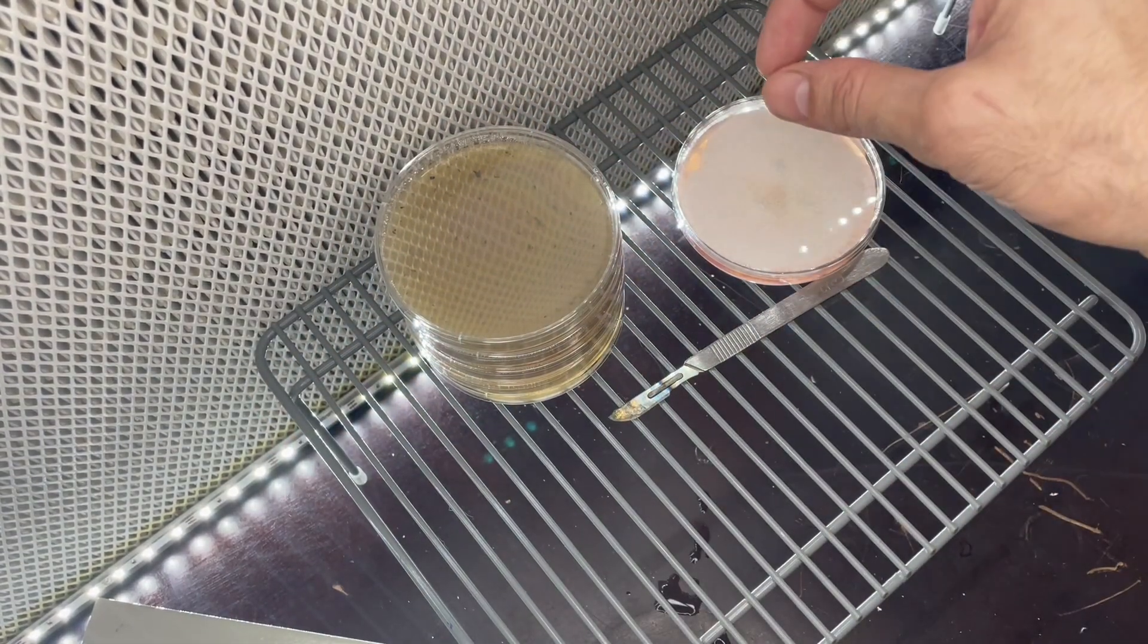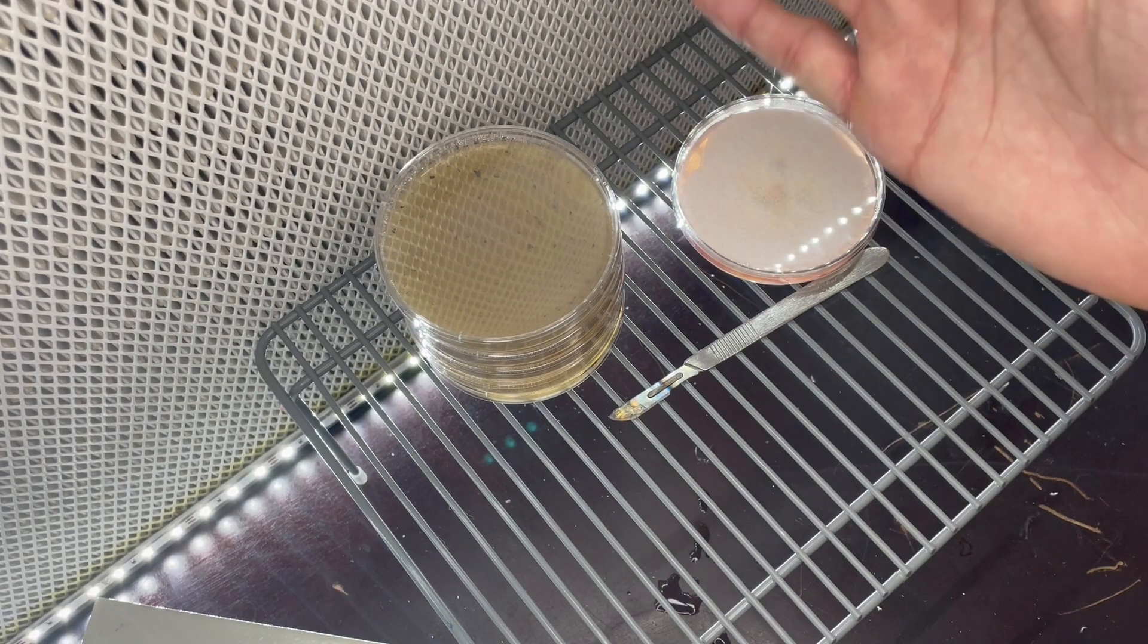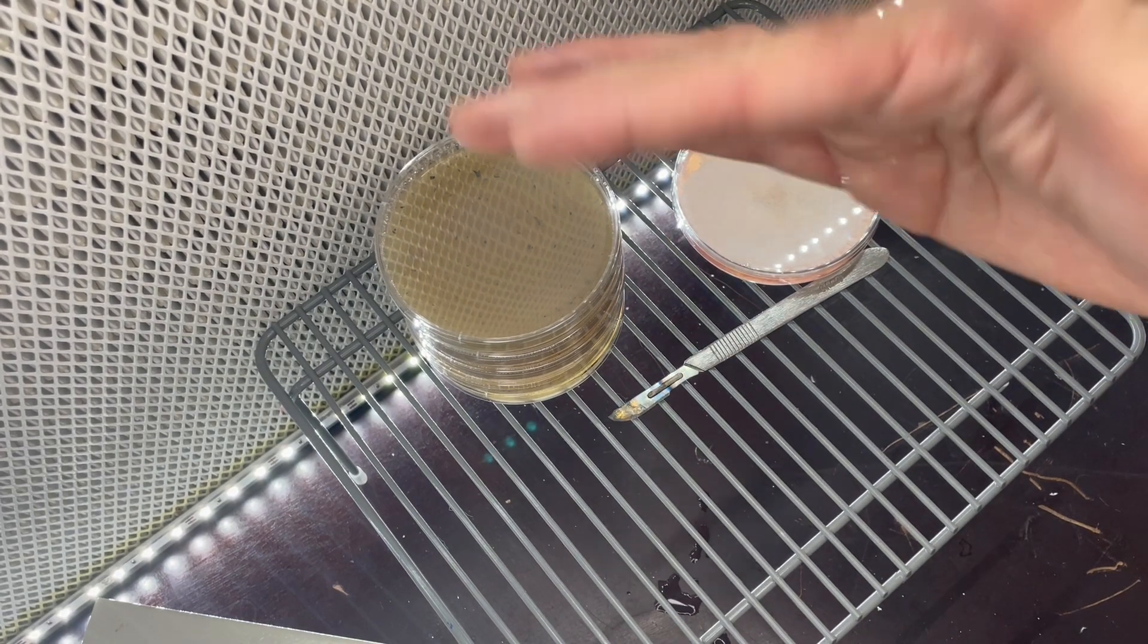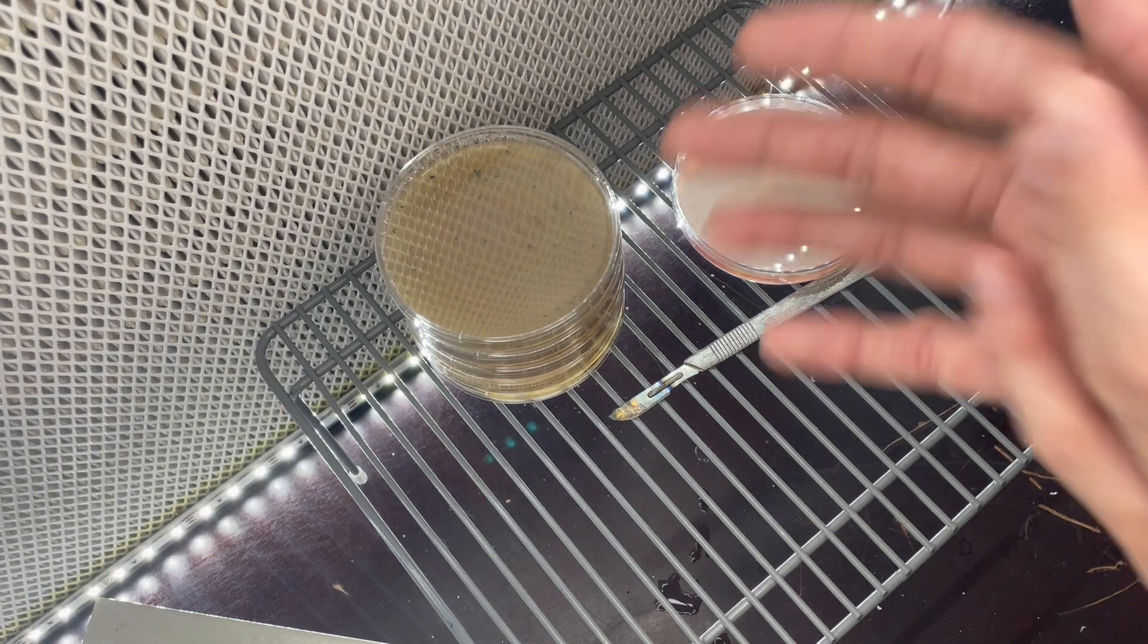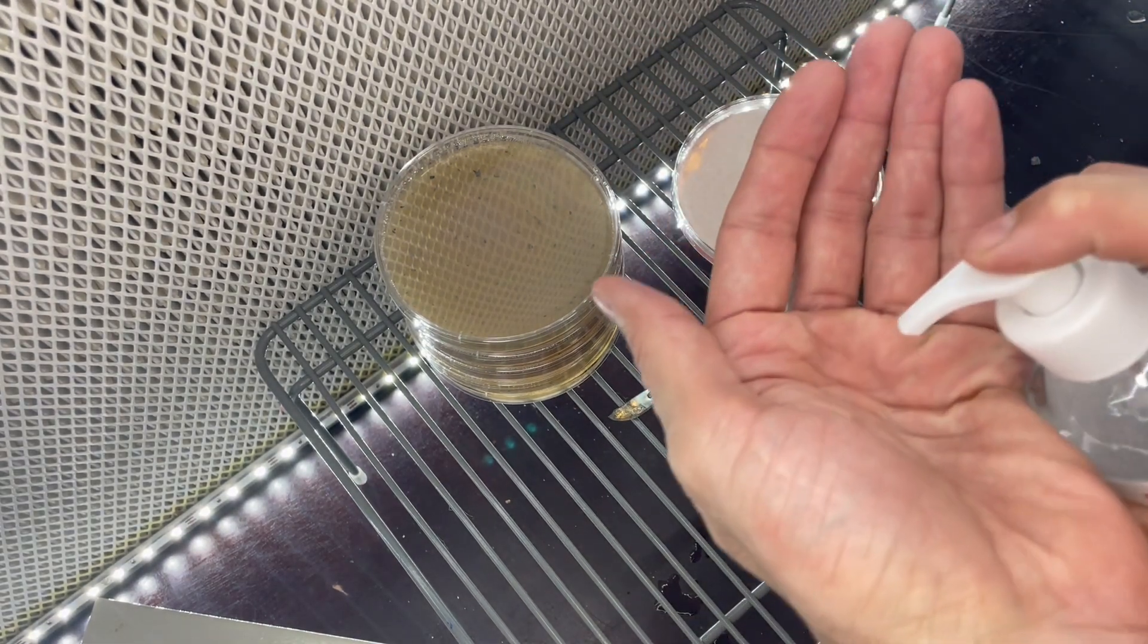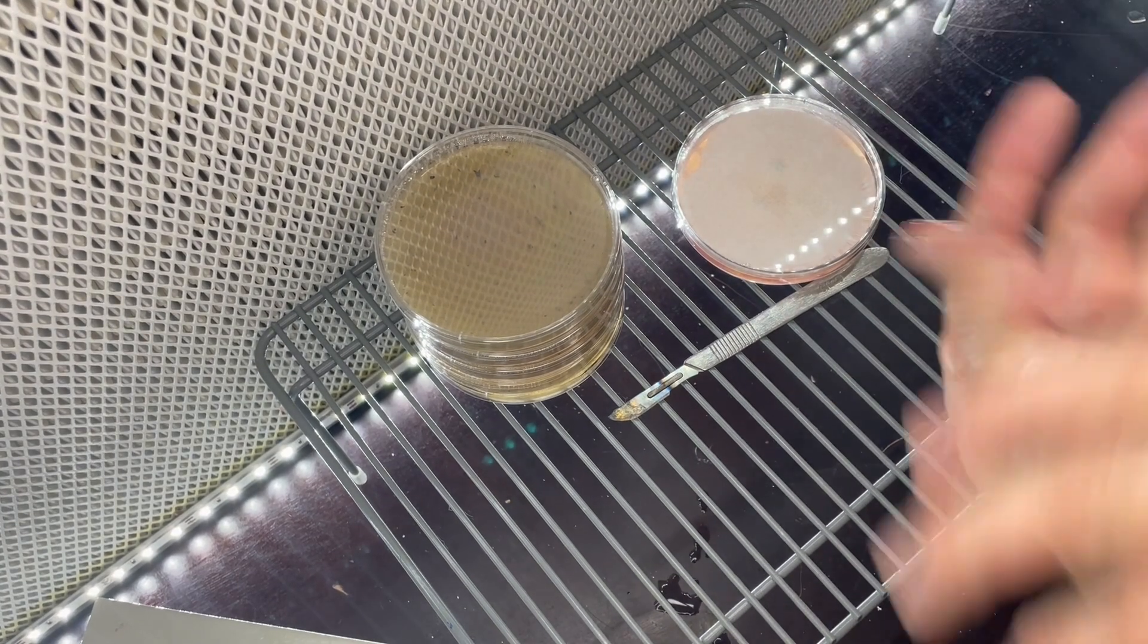This is the most sterile way. We're right in front of a flow hood. Our flow hood has been running for about half an hour before we ever start our work. We spray our whole area down with Lysol, alcohol on your hands always before you work. You can't be too clean here.